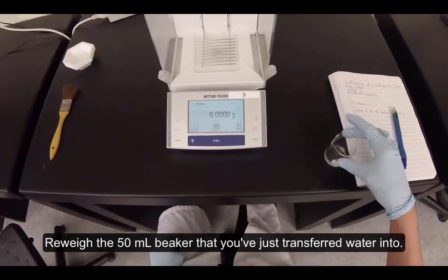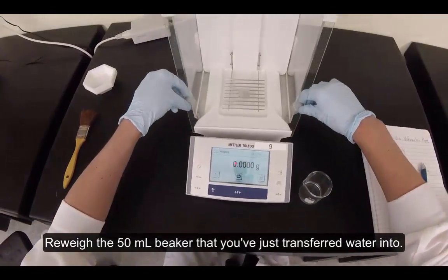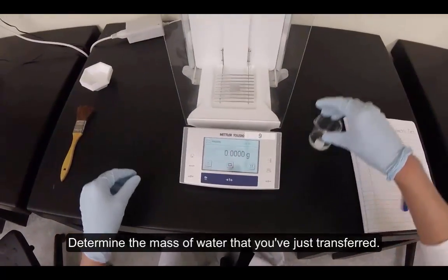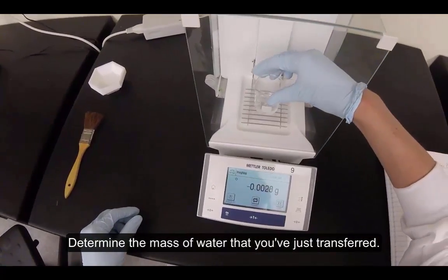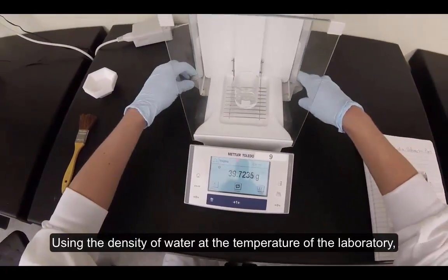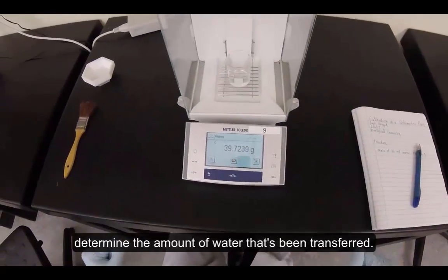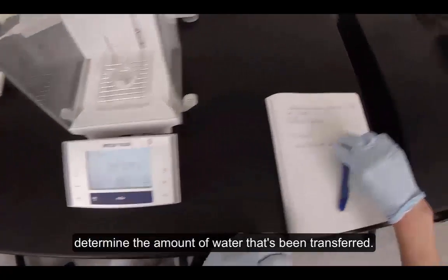Reweigh the 50 milliliter beaker that you've just transferred water into. Determine the mass of water that you've just transferred. Using the density of water at the temperature of the laboratory, determine the amount of water that's been transferred.